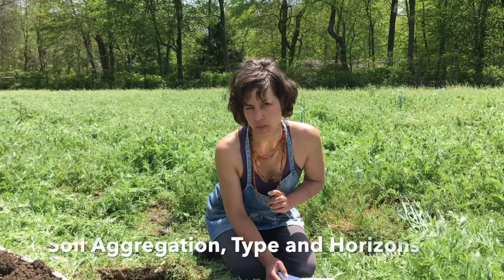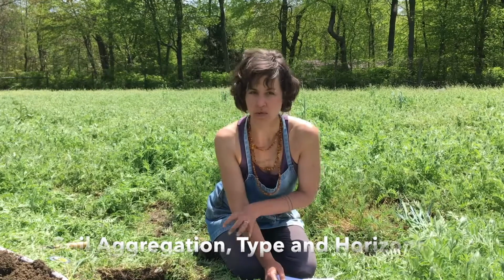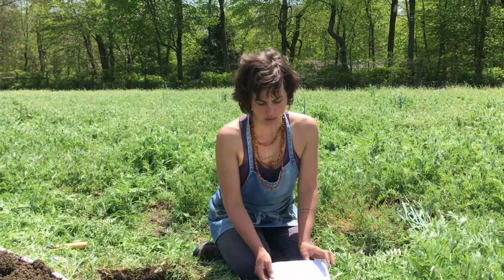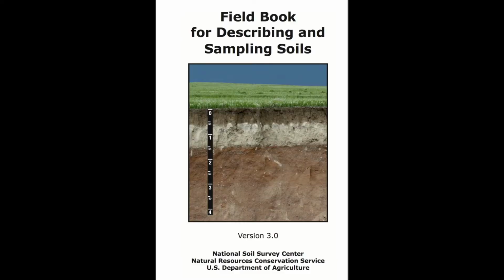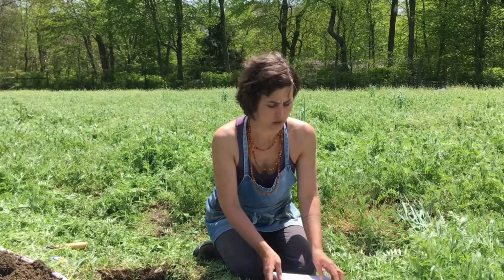Next test is aggregation, and this part's probably the trickiest part of the whole set of protocols. What we're doing is classifying the aggregates that we find in the soil, and we want to be using the NRCS classifications for aggregates. You can find a full description on soil aggregation in a field book called the Field Book for Describing and Sampling Soils, which is put out by NRCS. You can find that on their website. We have a simplified version of their categories in the protocols just to make it a little easier for you, but if you wanted the expanded version of it, you can use their original resource.